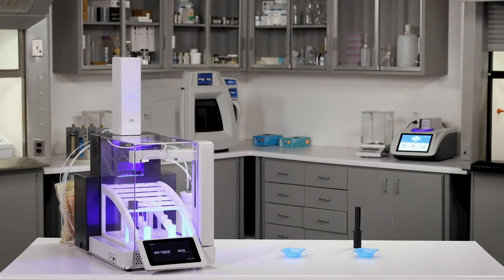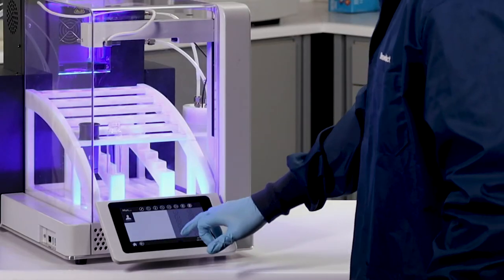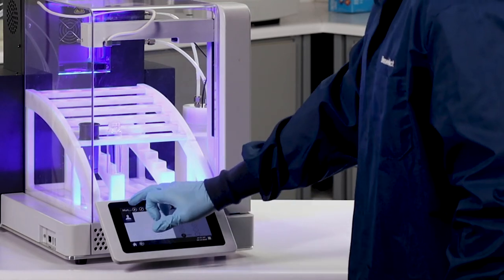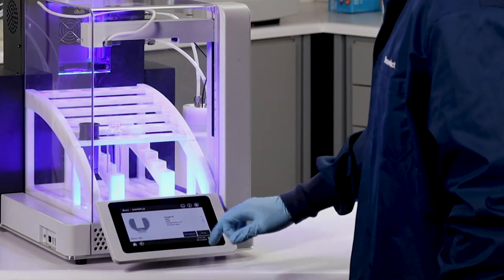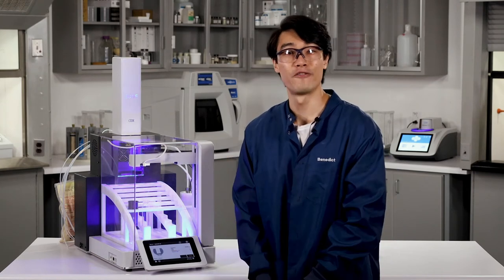Come up to the front, get that loaded method, press play, press start, and now I'll let the Edge run, and I'll see you all in a few minutes.